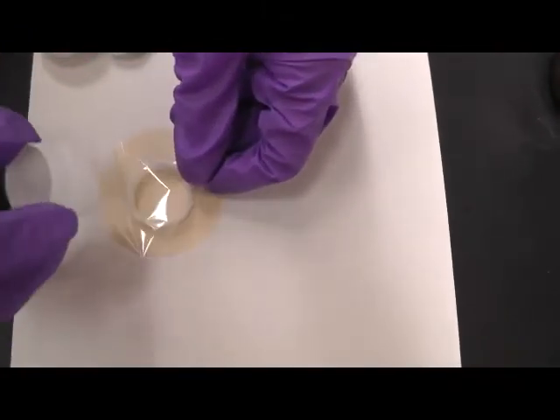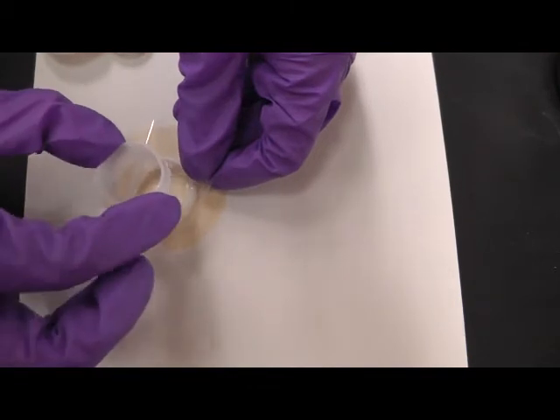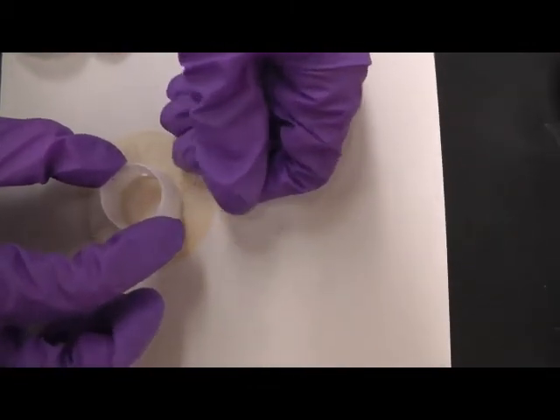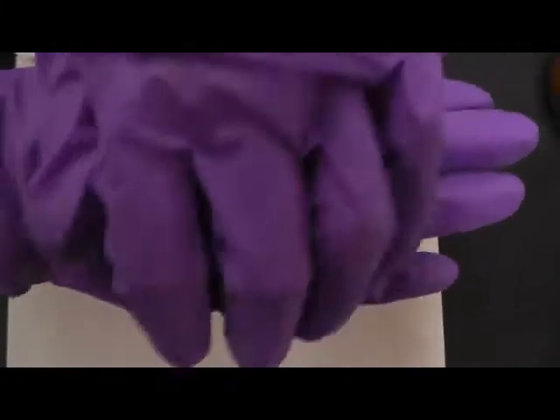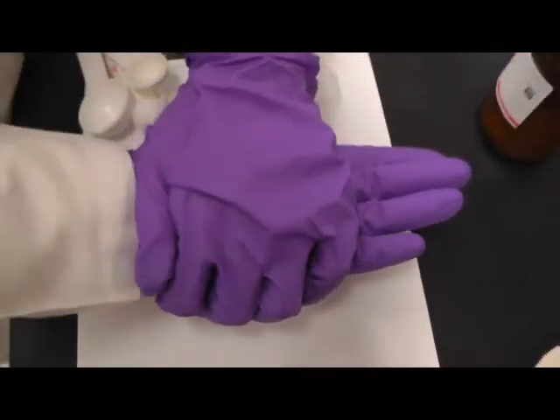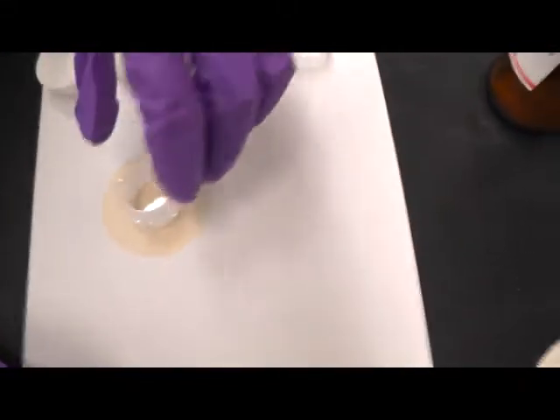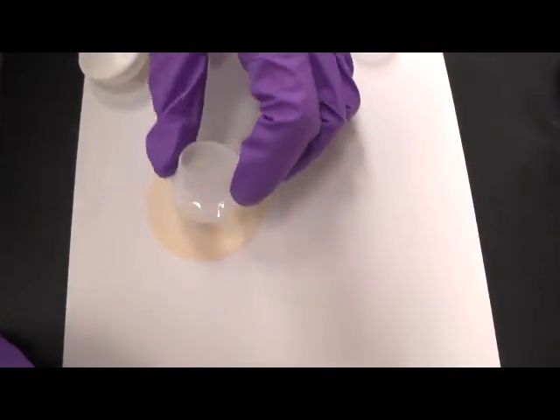And you put the thin film on the top of the ring. And now you try to push down the middle part. Just push down until you hear a click.